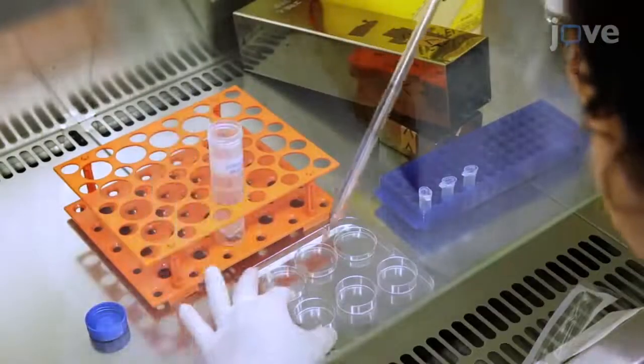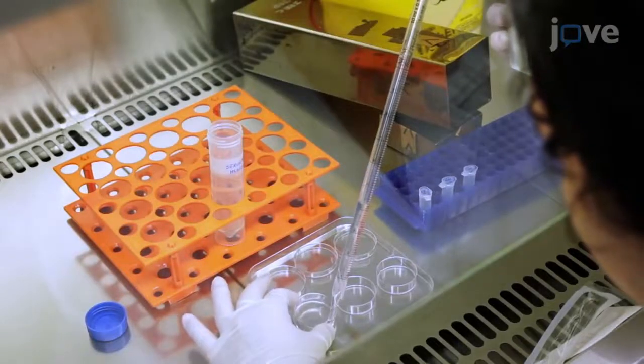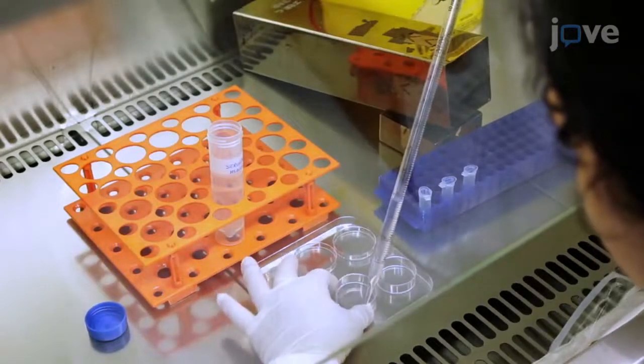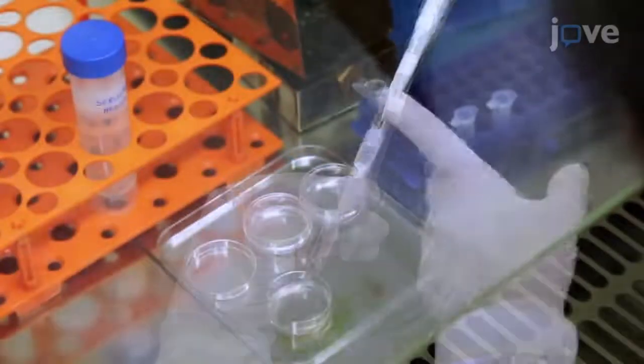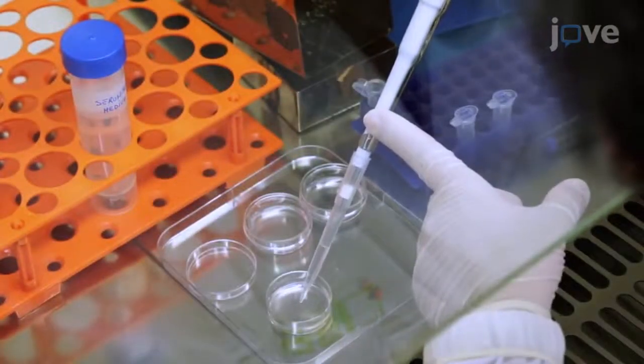Replace the medium on the cultured cells with 1.5 mL of serum-free medium. Add the DNA-liposome mixture slowly and drop-wise to the cells.